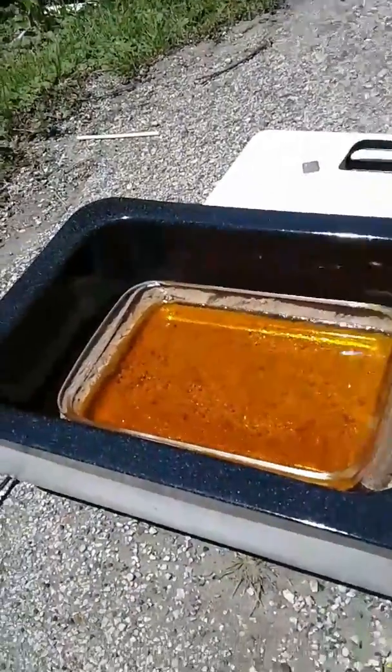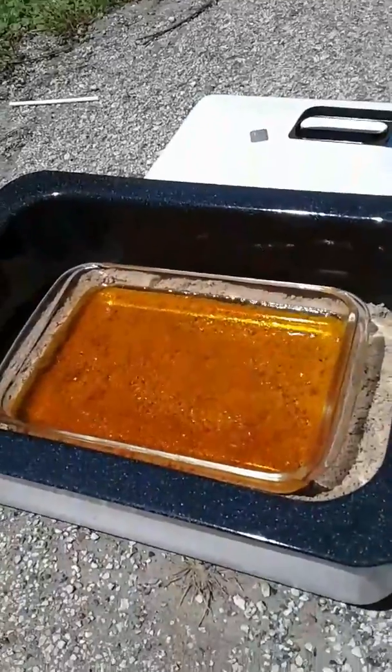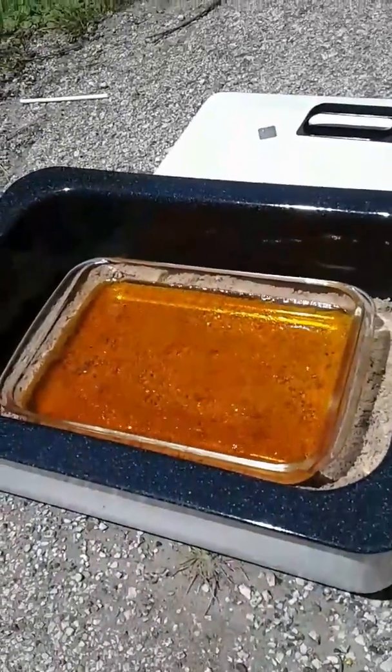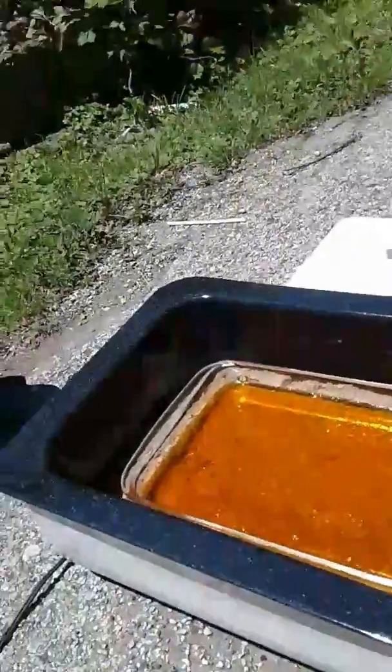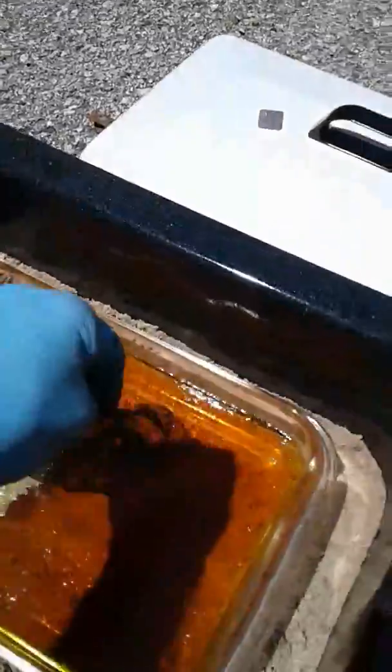I just came out after making my mixture to see how my acids are doing, and they've only been here about five minutes and they are boiling — so I turned it from 450 to 400. I had the lid on it, which is cool because that keeps any leaves from falling in since I'm outside. You want to be away from people, away from anything metal, away from cars, animals, children — all those things. There was no reaction with nitric alone, and no reaction with hydrochloric alone.